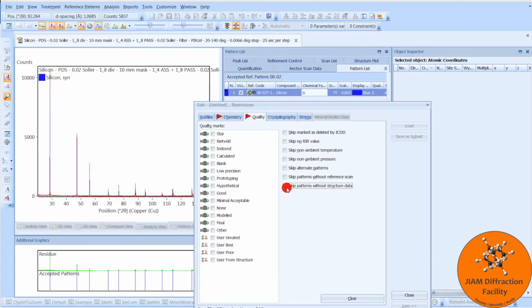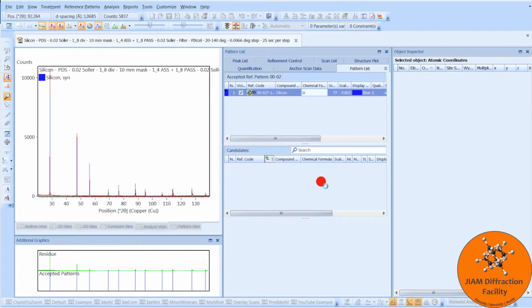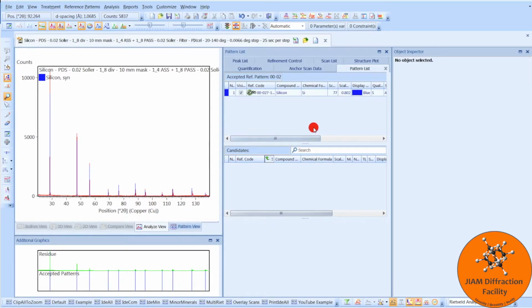Now, if you click this button, it will skip patterns without structure data. What this means is that when you perform your search, the only candidate files that you will see have atomic coordinate information in them. It will ignore all of the ones that don't. So then you would just close, search, and then say OK. I won't do that because I don't have the database installed right now, but that is what you would do.